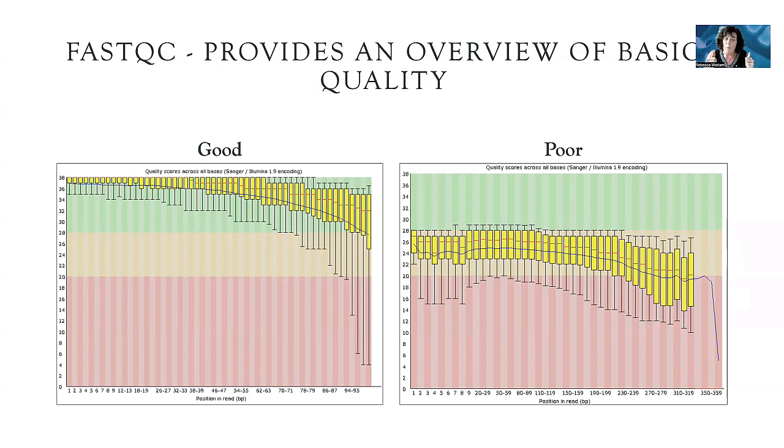And so the one thing to remember, if nothing else, is that green is good and red is poor. So on your left, you have a good example where most of the reads are good quality. You can see that at the very end here, you have some tailing into the orange, and these are standard error bars. It's showing that some of the reads are down in poor quality, but some of them are also in good quality. So when you're looking, that's the one way that you can interpret this. And this, you can see that this guy really isn't very good at all. If it's in Illumina sequence, it's not a good one.